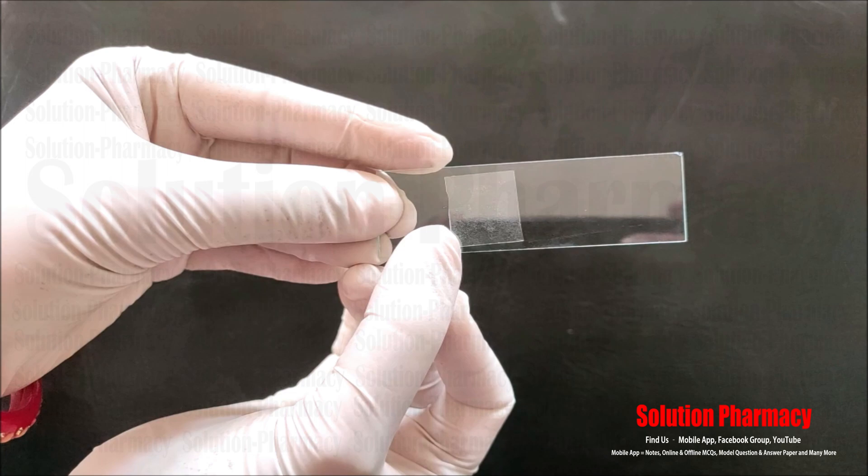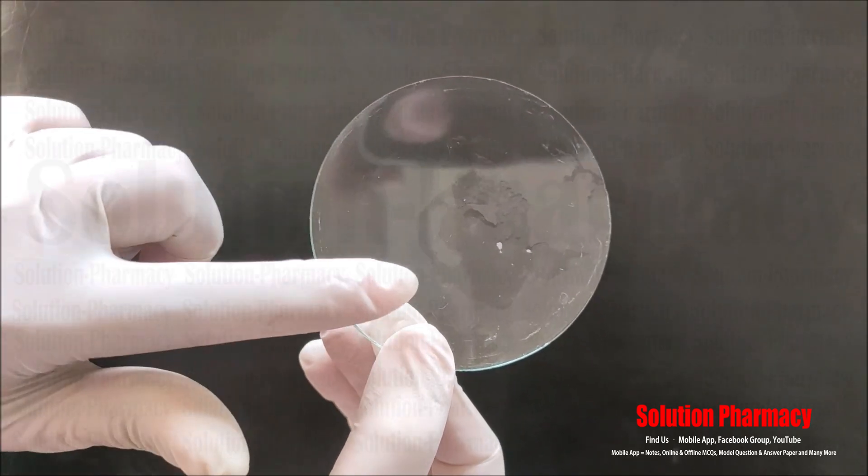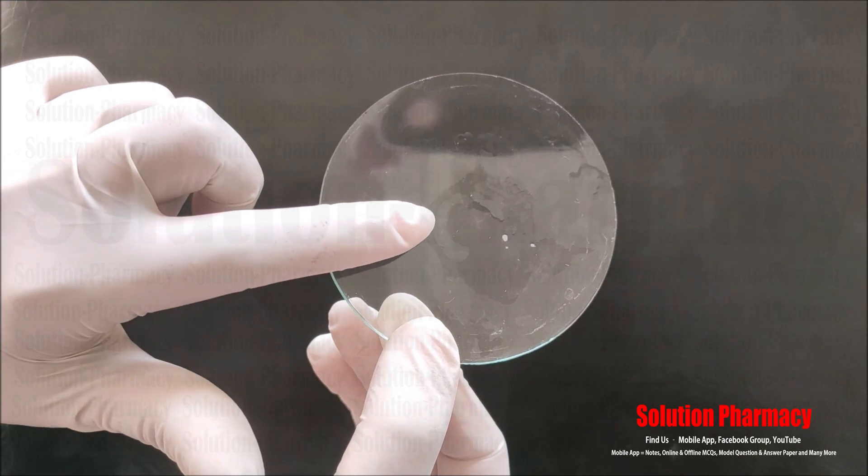The cover slip protects the specimen, prevents it from drying out, holds the specimen in place, and also protects the objective lens of the microscope from staining.